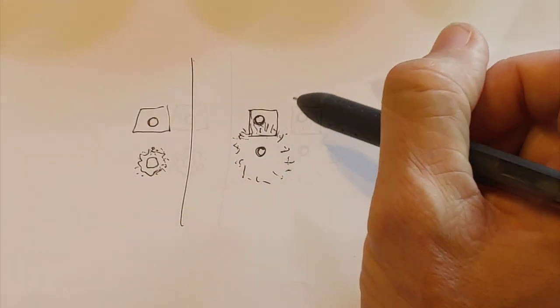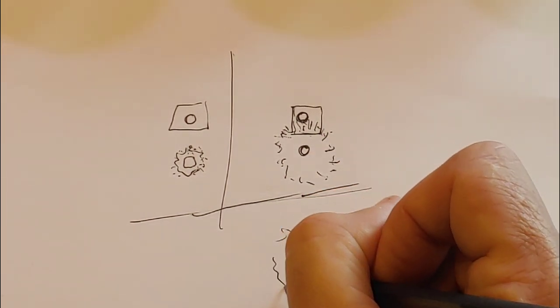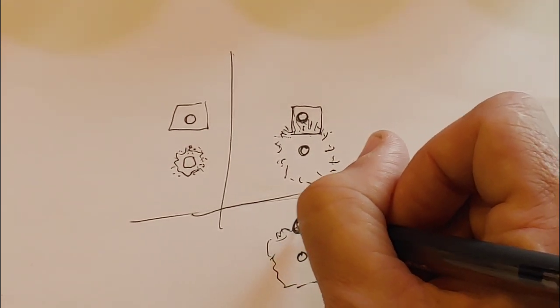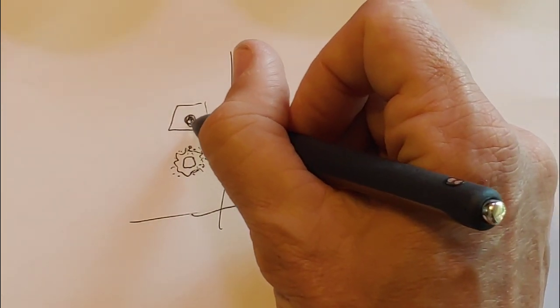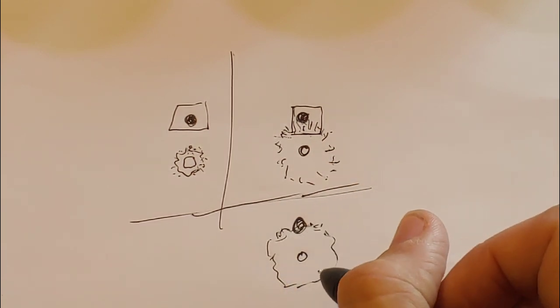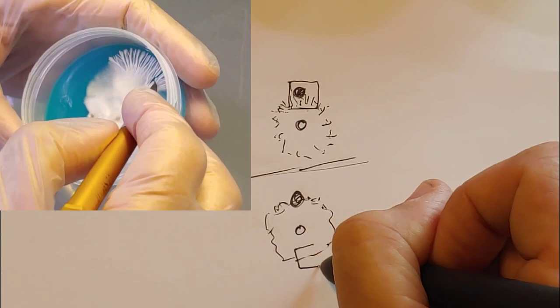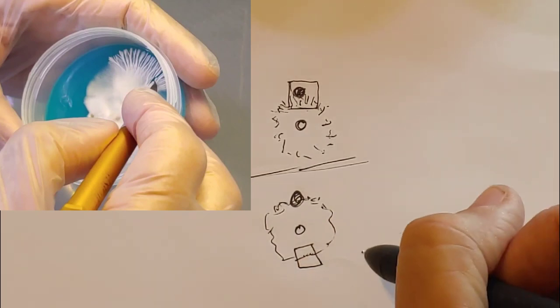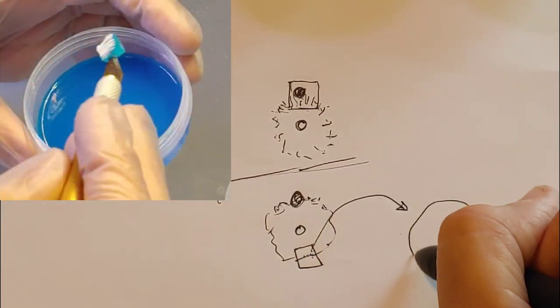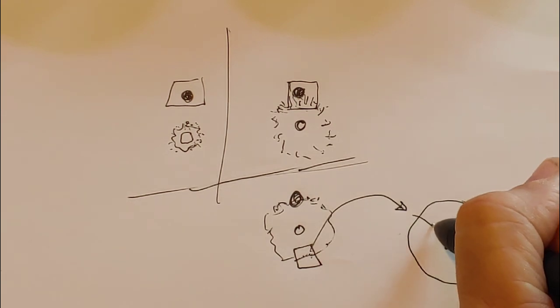What I would have done is this. This is our mycelium, say contamination already touched it. I would find the farthest part away from the contamination and then cut a piece from there. Probably right there. And then put that in a new agar dish right in the middle.